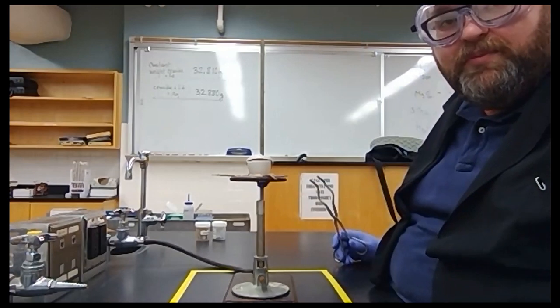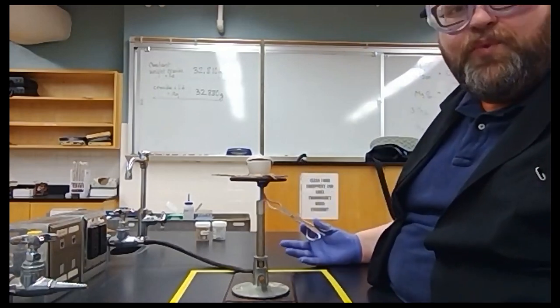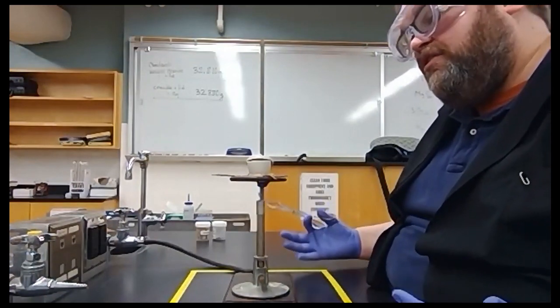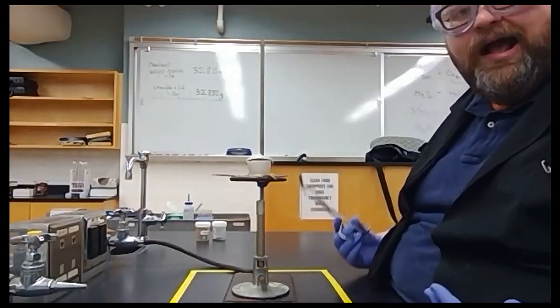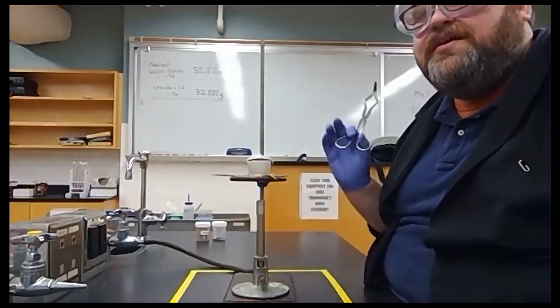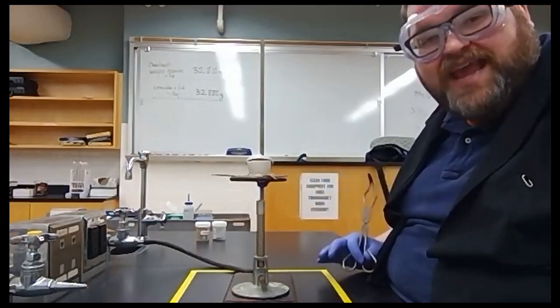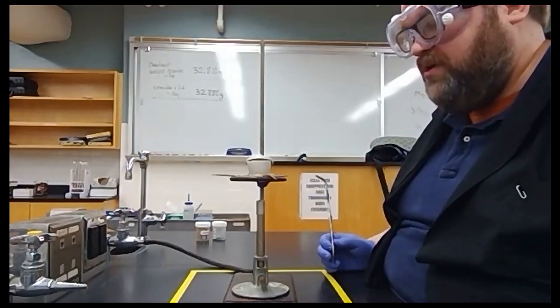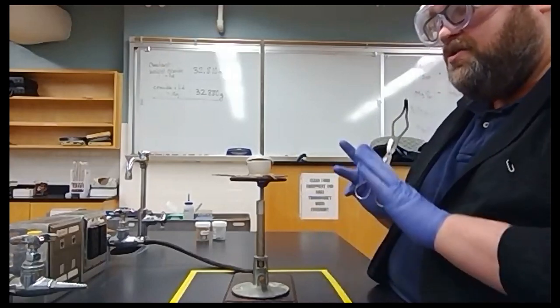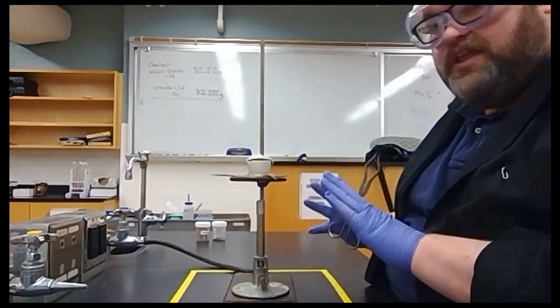After this, it's a waiting game. It can take anywhere from five minutes to 35 minutes for that magnesium to get hot enough to spontaneously combust, because that's what we're waiting for. It's spontaneous combustion. So we're just going to set this here and leave it.